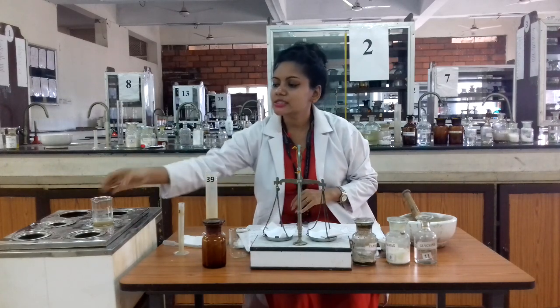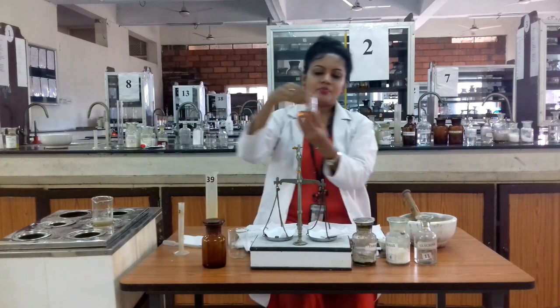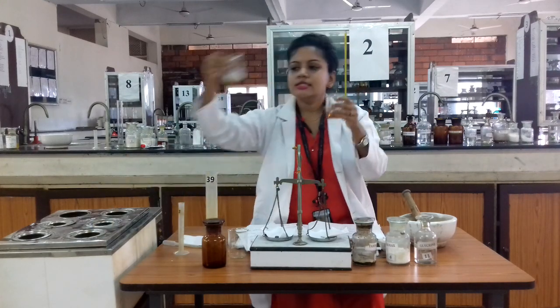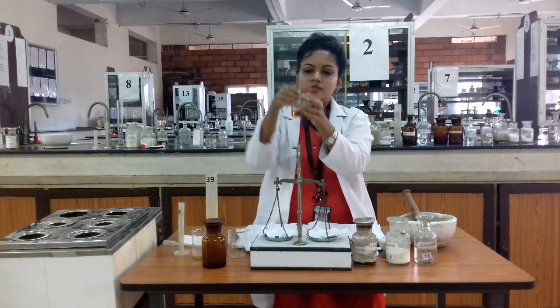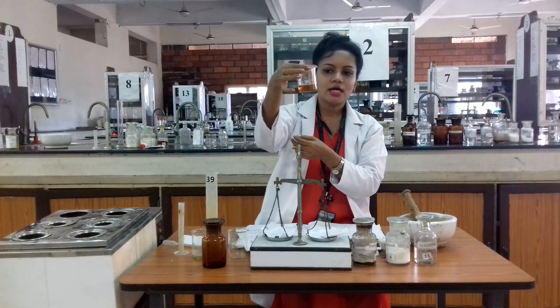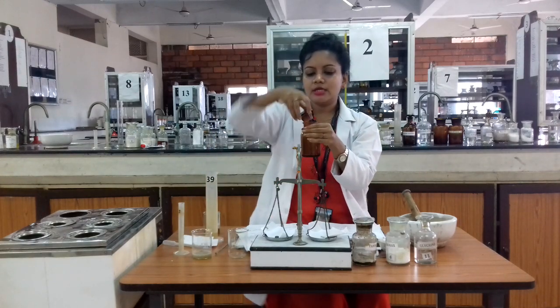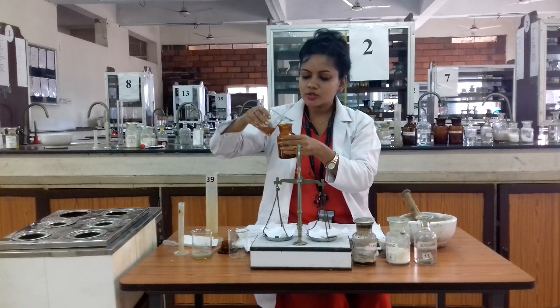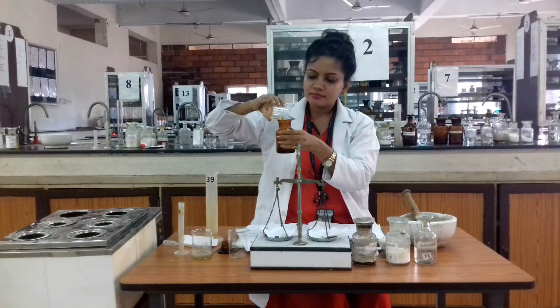After the preparation is ready, we take it out from the water bath. Now the color has changed — before it was a light color, and after the water bath we get the tannic acid glycerin paint. Our dispensing bottle is an amber-colored bottle, since tannic acid has astringent properties. We transfer the preparation into the amber-colored bottle.